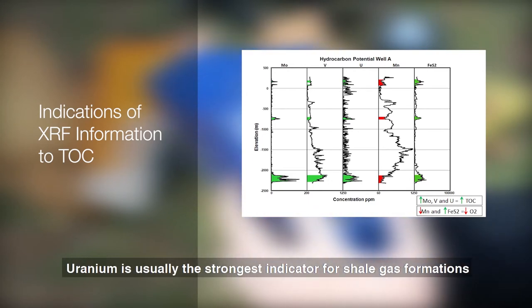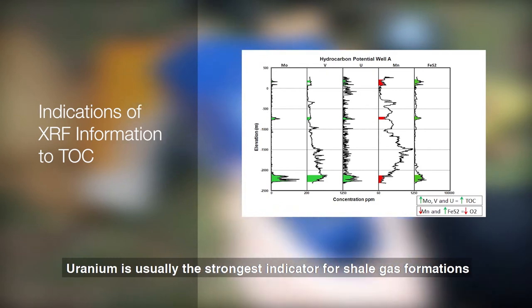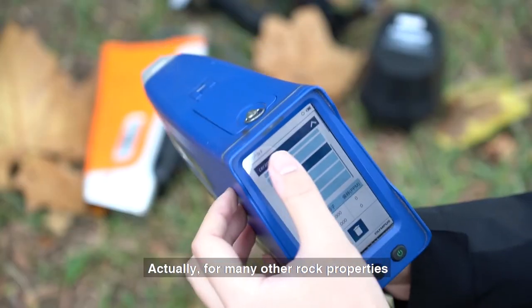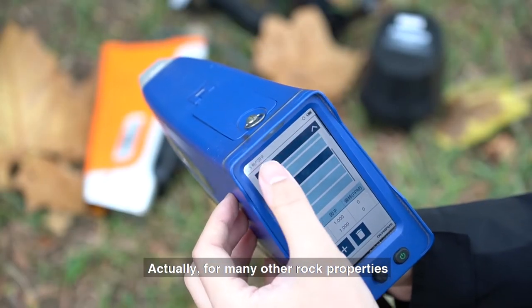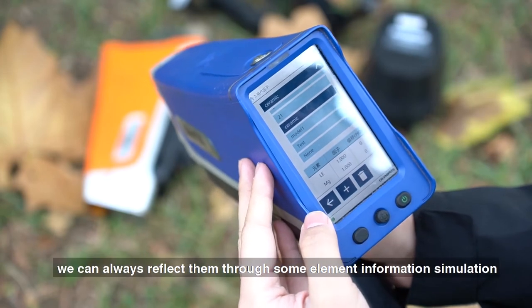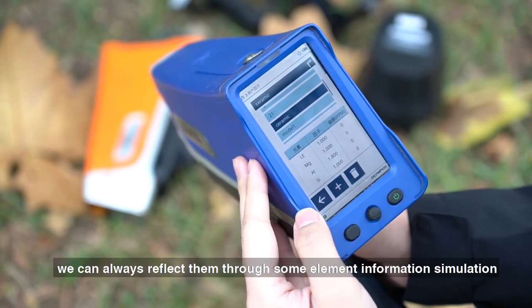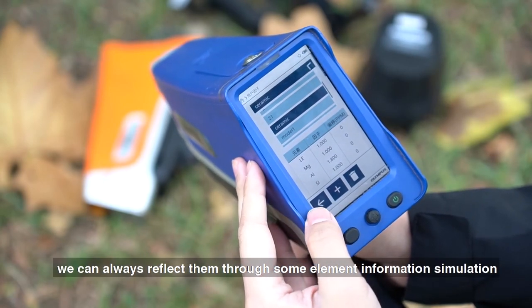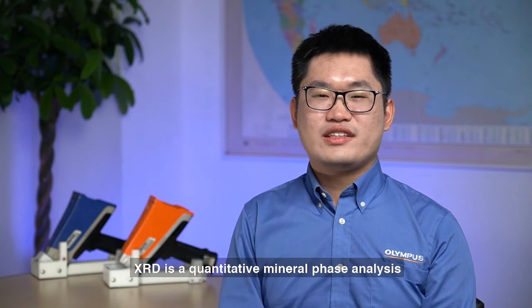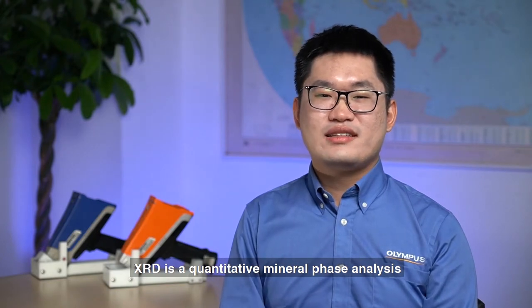Uranium is usually the strongest indicator for shale formations. In fact, for many other rock properties, we can reflect them through elemental information and simulation.